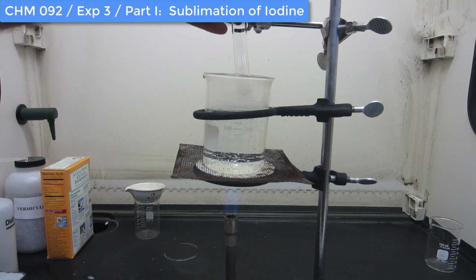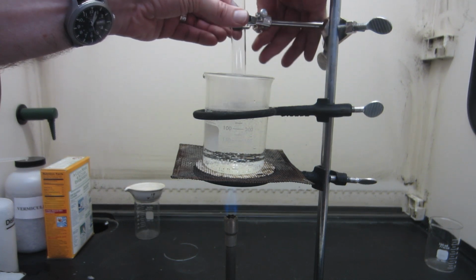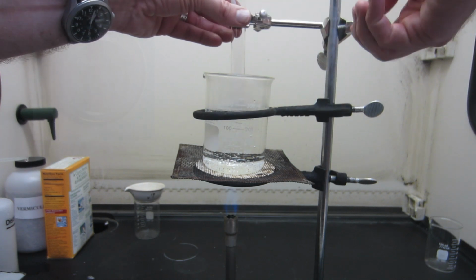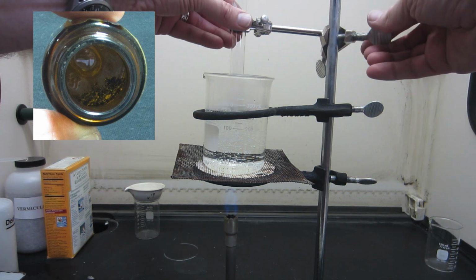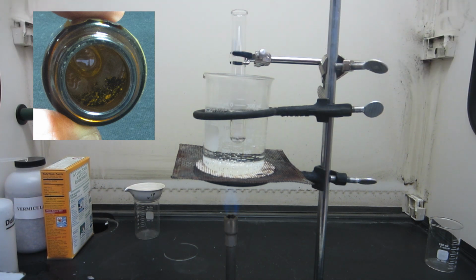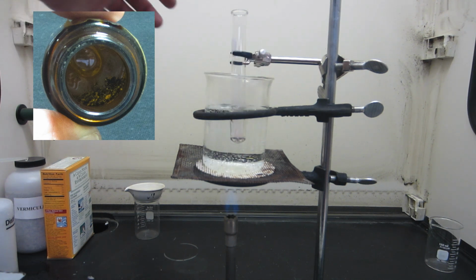In the first part of this reaction, it's a sublimation process. Sublimation is when a solid sample has a phase change directly to a gas. And the sample we're going to be looking at is iodine. So it's one of the halogens on the periodic table. And the photo there, the insert, is a photograph of the iodine crystals in there. You can't tell, but the crystals do take on just a very slight purple luster to them.